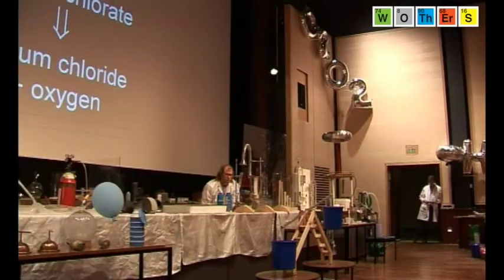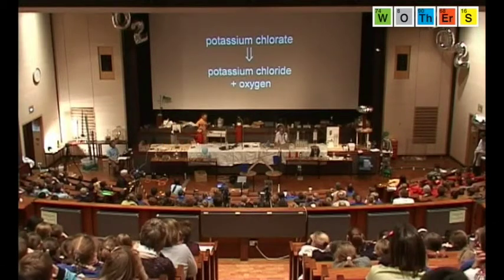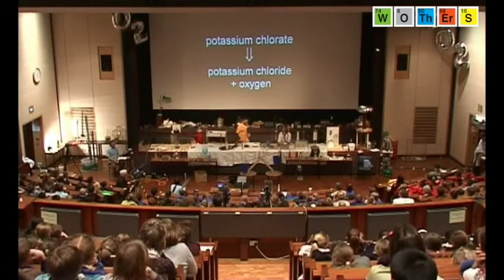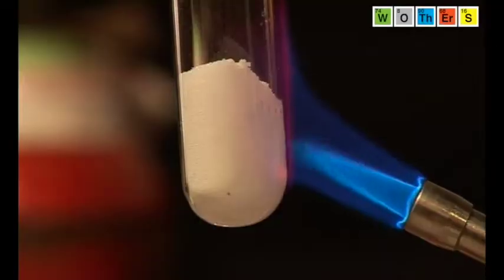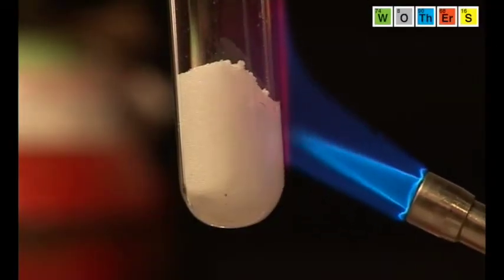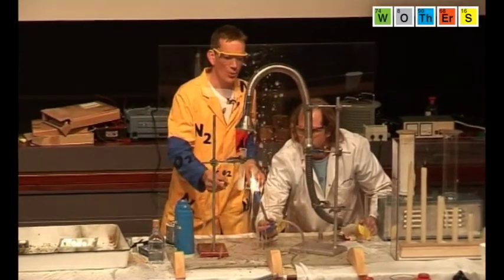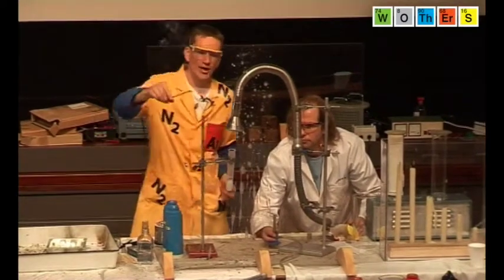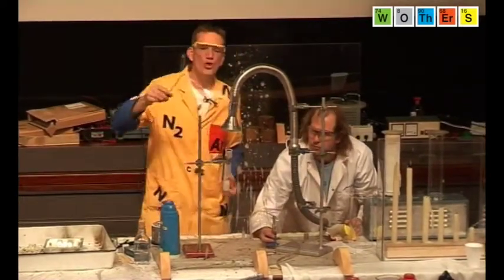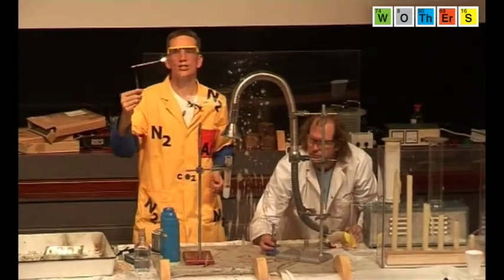Well, we can show this now. Have a very similar reaction. This is not sodium chlorate, but potassium chlorate. And Chris here has been heating up some potassium chlorate, releasing some of the oxygen. And I can show this with a wooden splint here. What I'm going to do is blow out the splint. So now it's not alight, it's just glowing. But if I put this into the tube, the oxygen that's being given off here relights the splint.